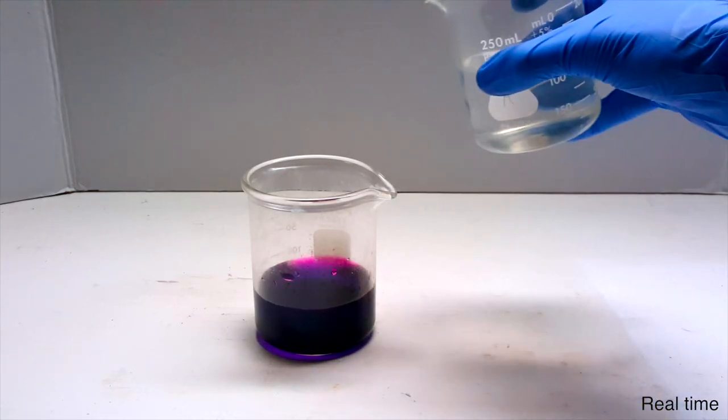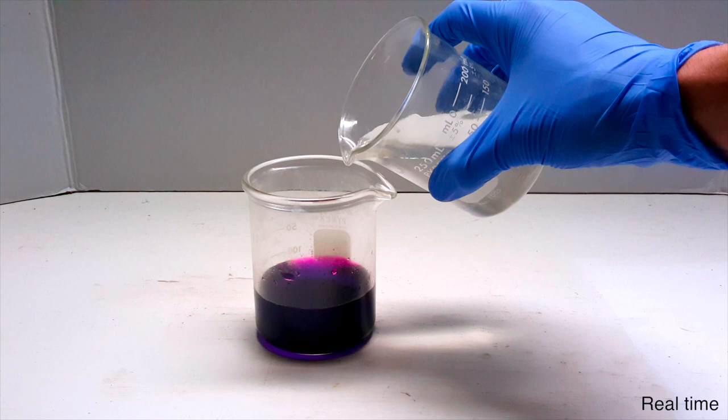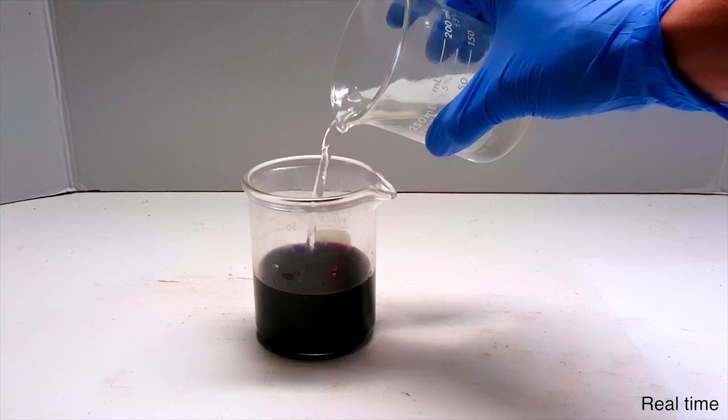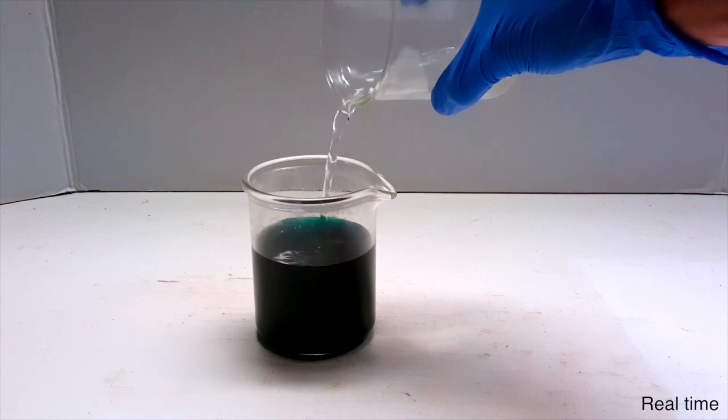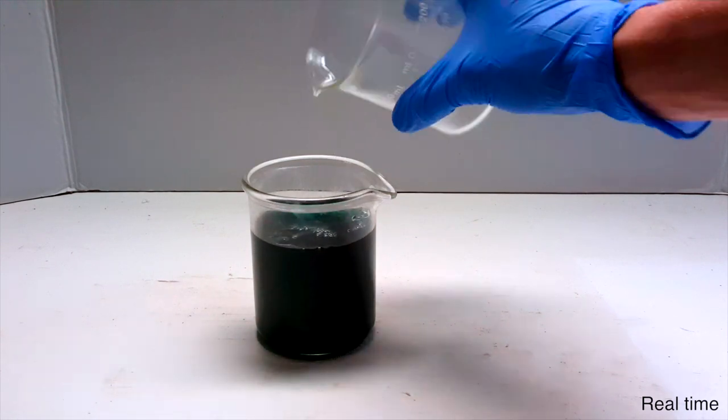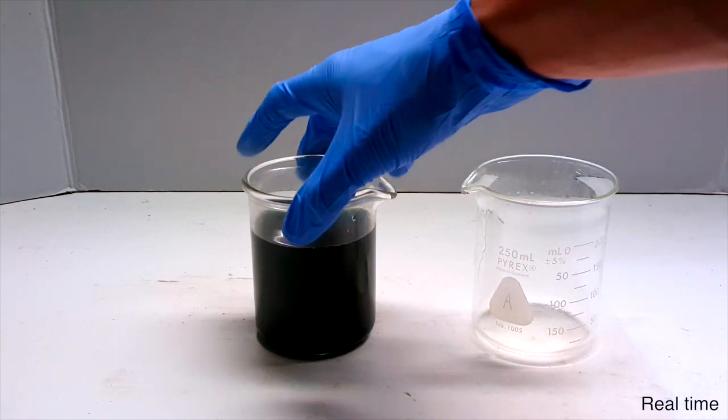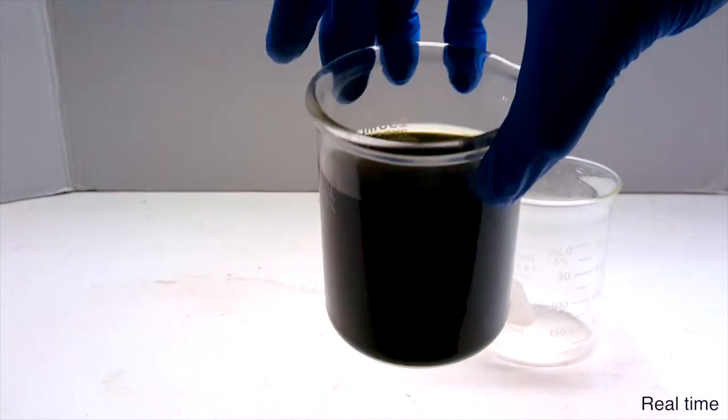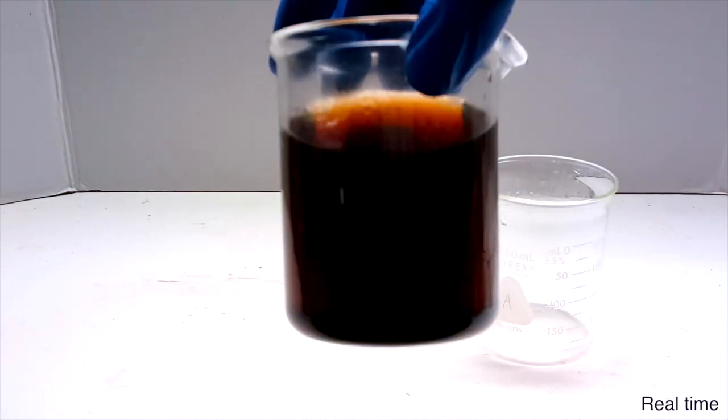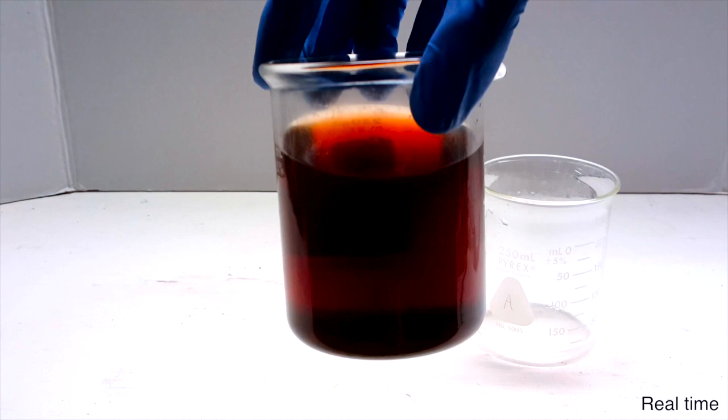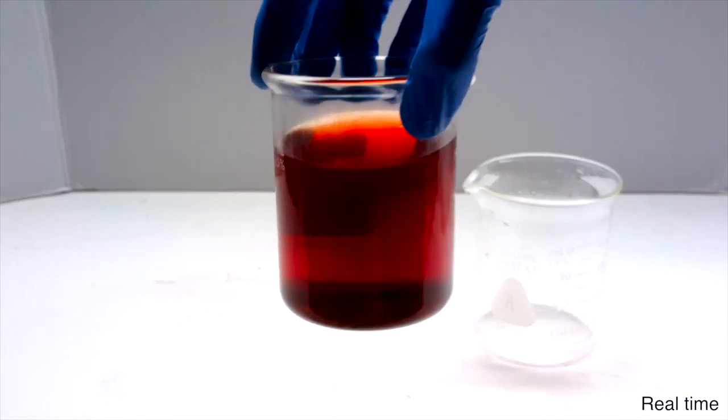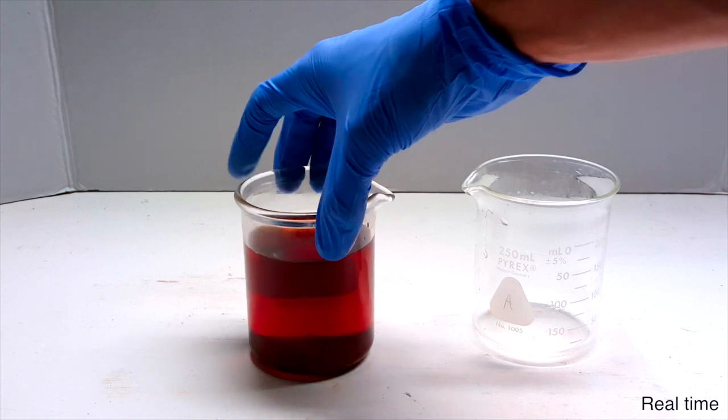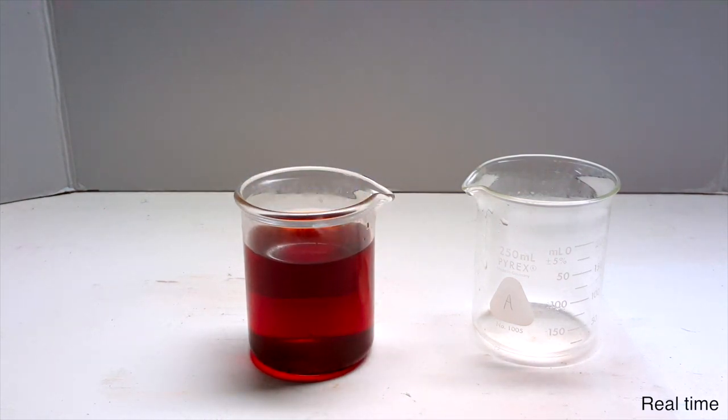Then it was about time to add solution A. Upon adding solution A, the mix turns a nice blue-green color. Then it becomes a darker green, a dark orange, and finally a nice red color.